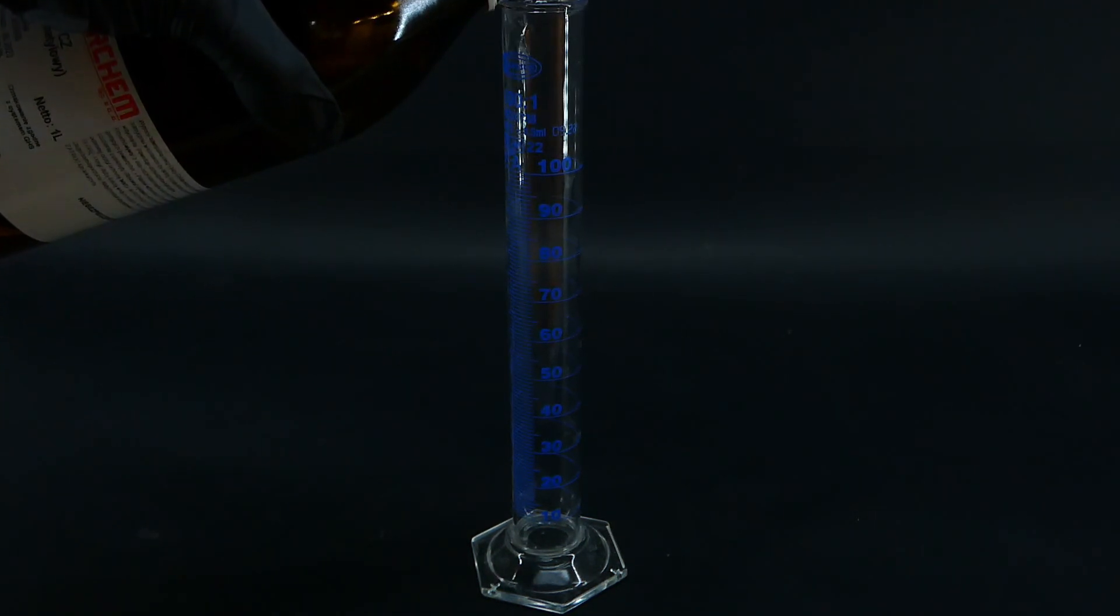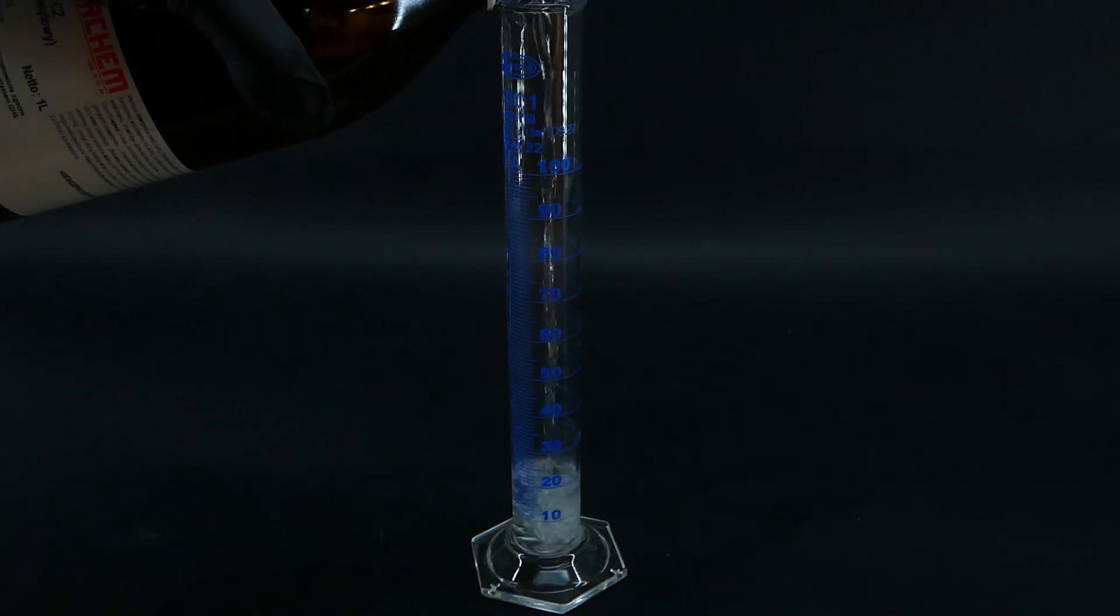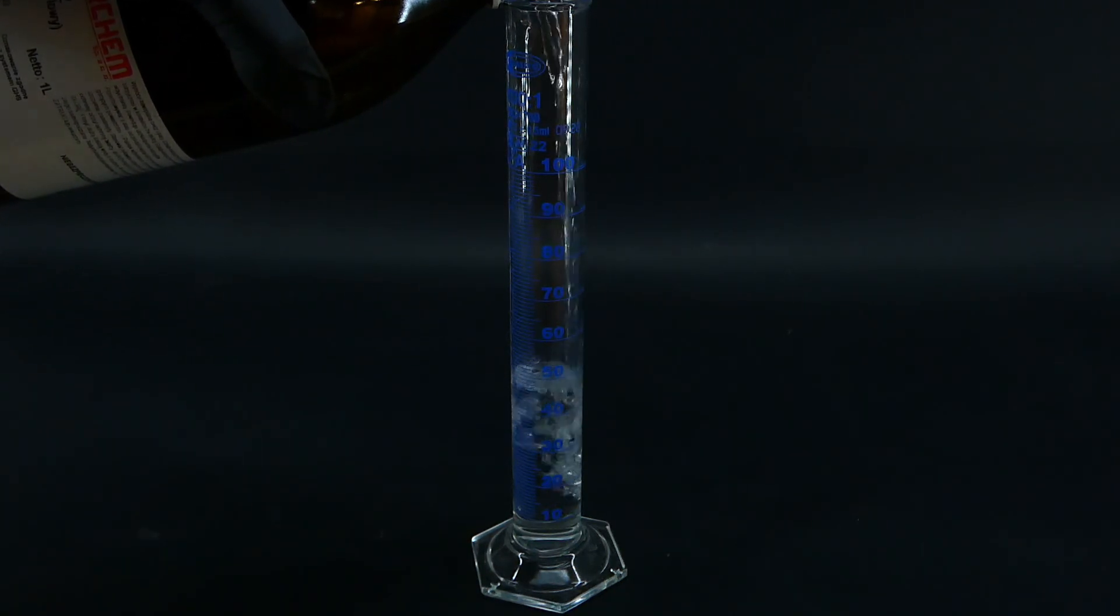I measured out 200ml of methanol into portions and added it into a large boiling flask.